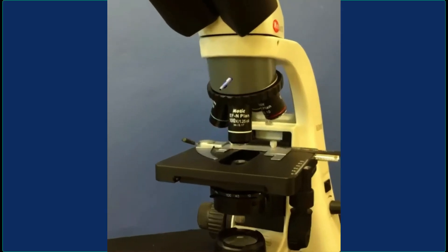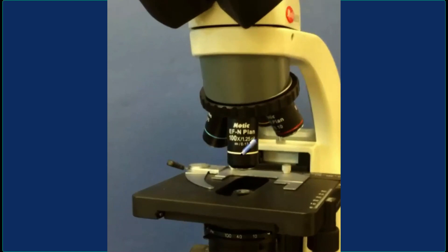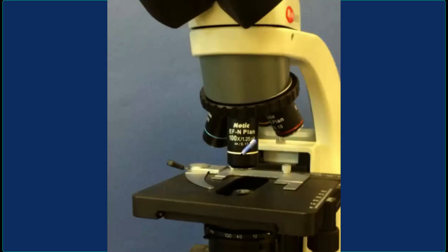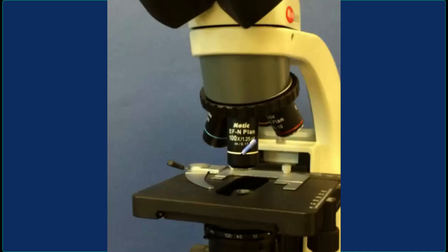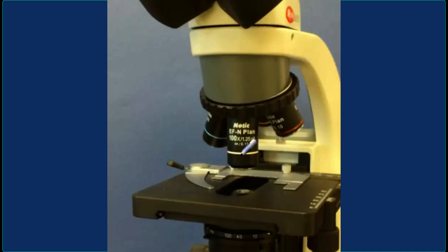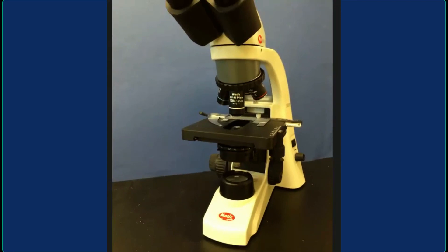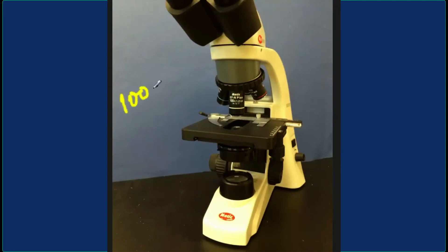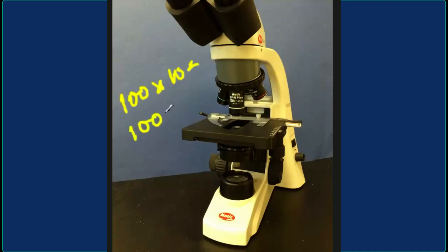Finally, this objective, which has 100x on it, is only used with oil — so this is the oil immersion lens. In order to get the optics right when using this lens, the light must go through oil, which allows this lens to work to its optimum design. The magnification you get with the oil immersion lens is 100 times 10, equal to 1,000 times magnification.